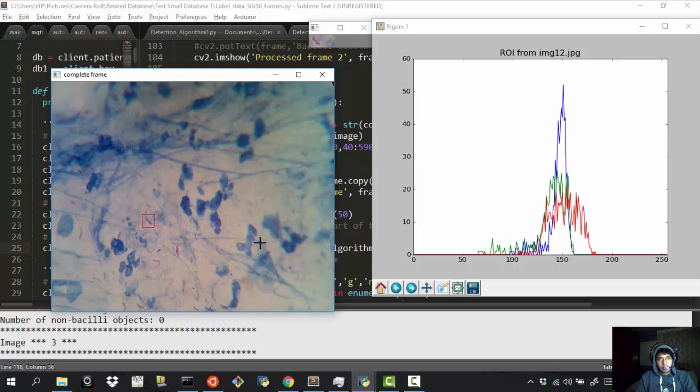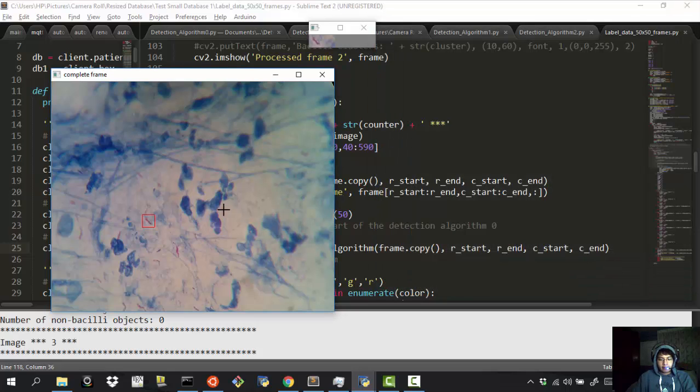And the most interesting part that is going to help me classify the images is, I don't know if you have read the previous log, but it said that humans make a lot of errors. If you look at this image over here, it's the same as in the microscope. If you try to find bacteria in here using only the microscope, not a digital image, there is a low sensitivity. Why? Because it is very hard to differentiate the bacteria from the background.